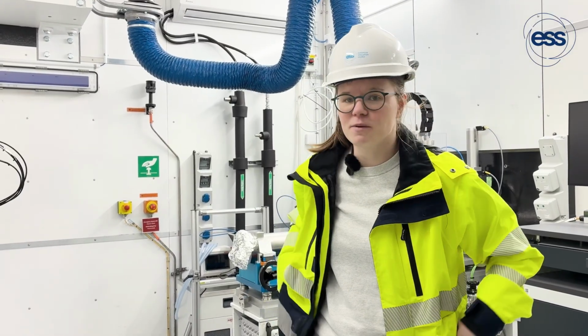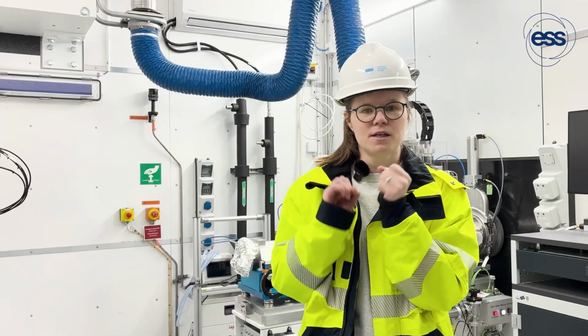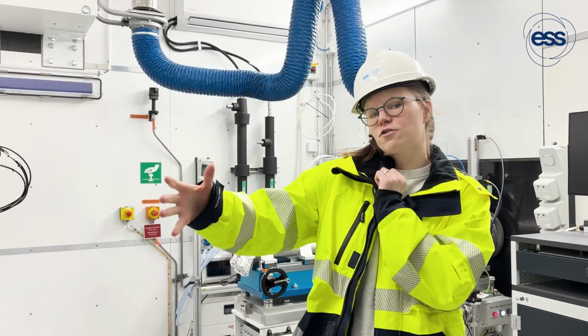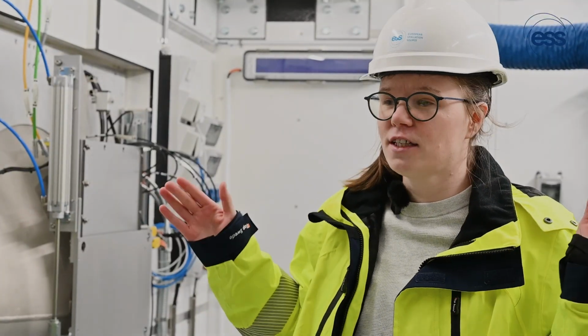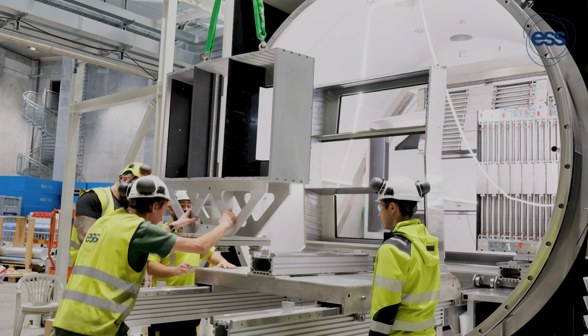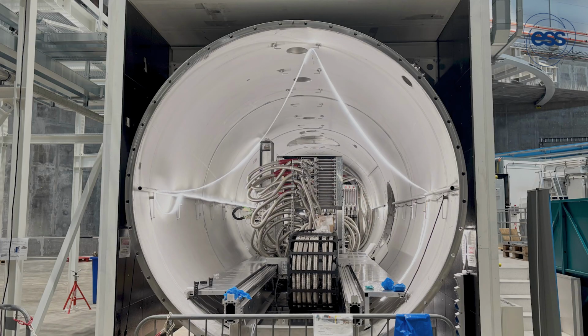And what happens is we have a very narrow beam that's collimated and fired towards the sample. It hits the sample, most of it goes through, and then a small amount of it scatters. That's collected on these giant two-dimensional detectors. In LoKI we'll have 9 of them, and within that two-dimensional pattern we have structure.